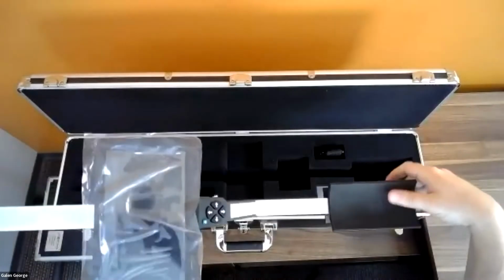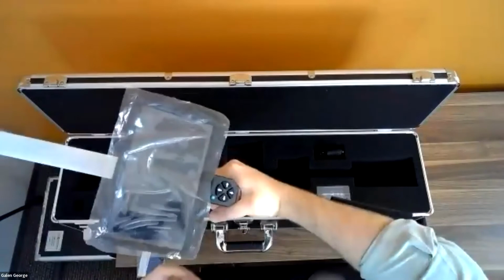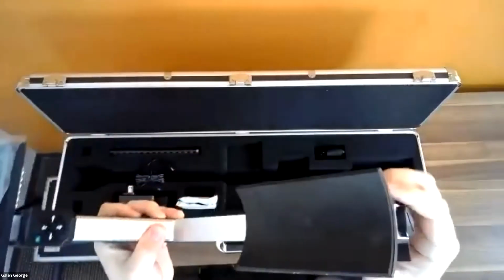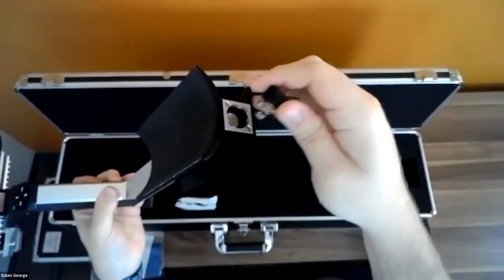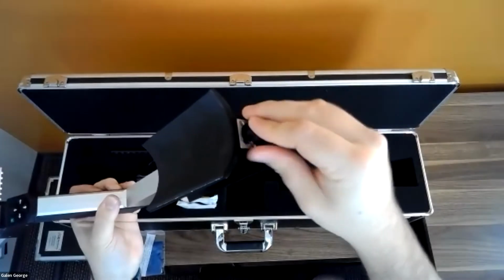This is just an armrest. If I were to hold this, it rests along my arm and helps with counterbalancing the weight, making it a very convenient instrument to use out in the field. And then the last feature is right here, the battery cap. If I unplug that by twisting it, you can see the batteries just go into this battery tube there.